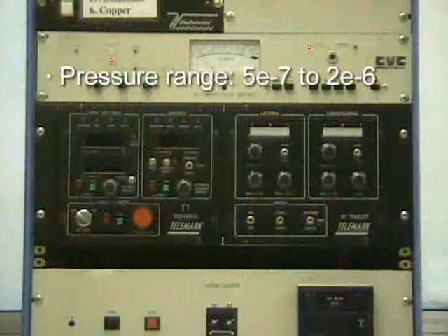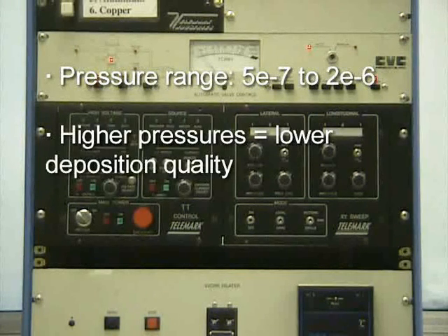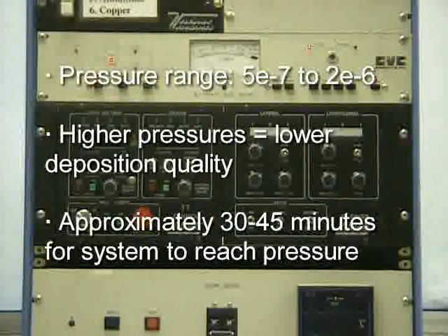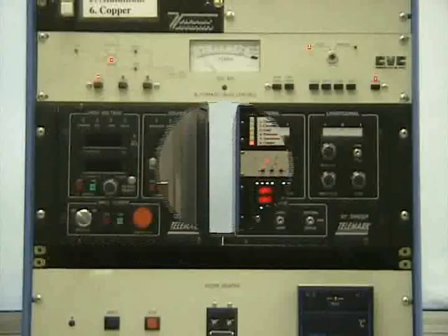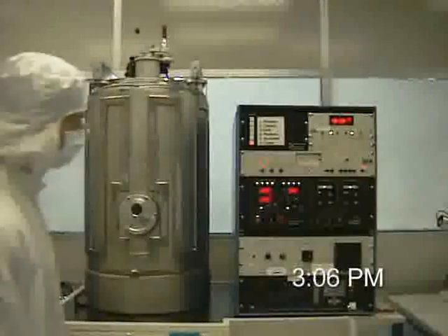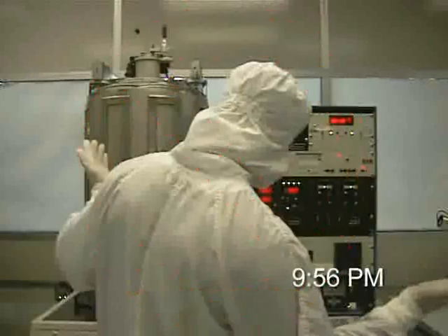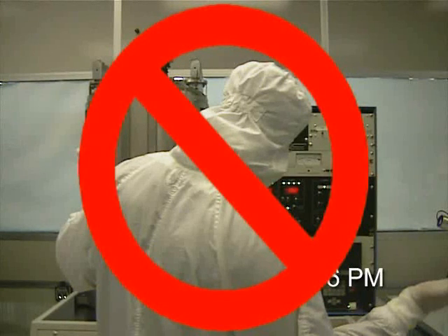We will wait for the pressure to come down to about 5 times 10 to the minus 7 to 2 times 10 to the minus 6 range. However, if you are not concerned with the deposition quality, you can start at higher pressures. If you want a low pressure, it may take 30 to 45 minutes for the system to reach the pressure you want. Do not leave the area while waiting for the chamber pressure to decrease. You must monitor the E-beam to ensure that the system is functioning properly.